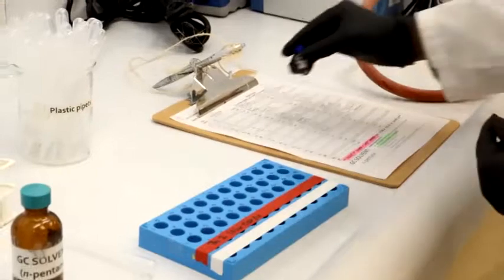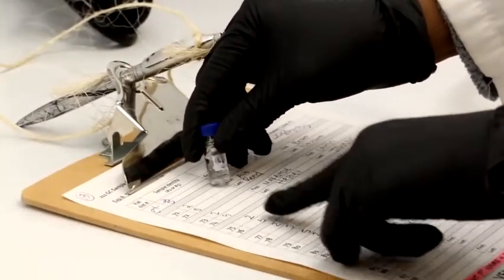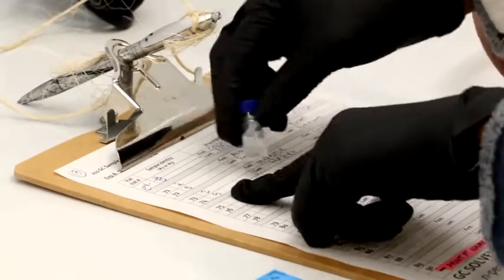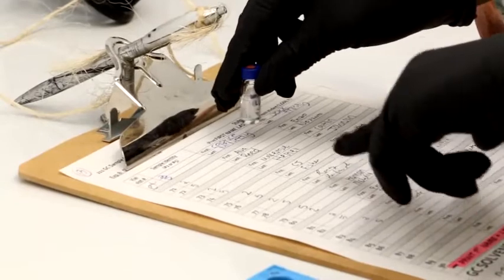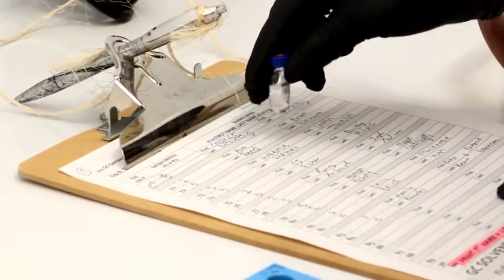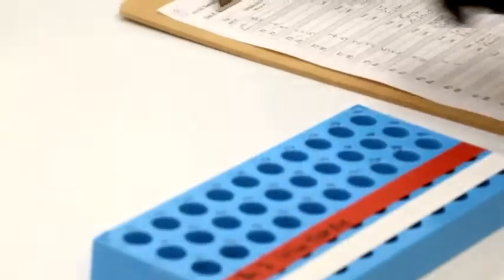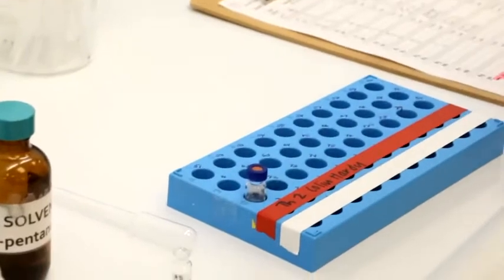You want to walk over. You want to identify who you are, what sample this is, and you also want to make sure that you have your 2 and 5 noted here, sample identity 2 and 5. You also want to make sure the names of the team that helped you with this experiment are noted, and you want to make sure that you put your sample in the actual slot that you have signed off on. Here we have slot number 71, and I'll go down here and I'll put that for number 71.